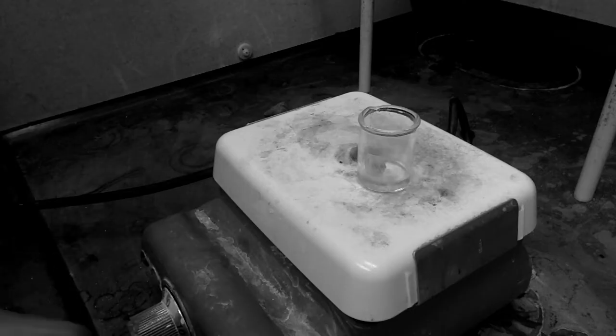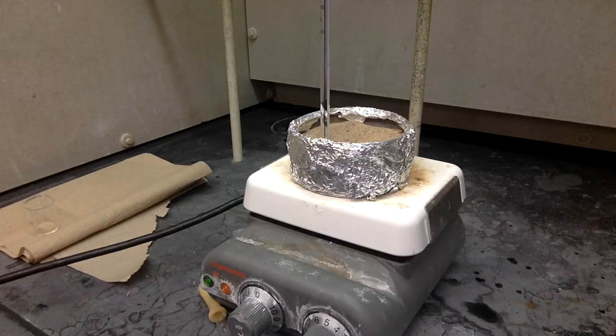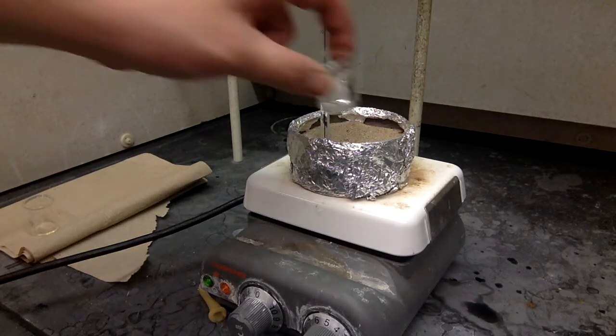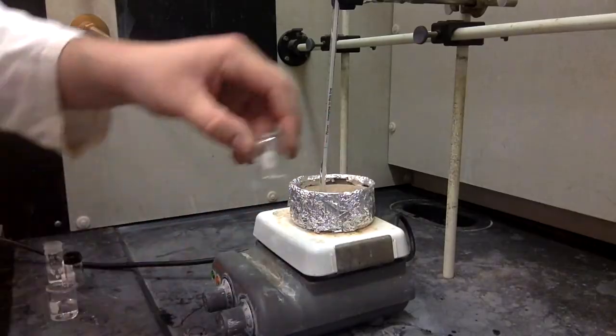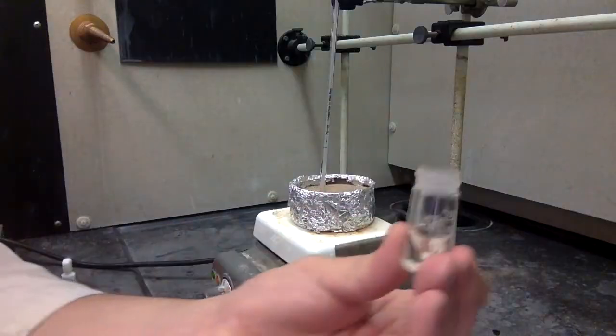Now here's the easiest part to screw up. You think everything's evaporating fine until suddenly you see a wisp. That wisp is your compound. Our product is a liquid and it has a low boiling point. So definitely do this in the sand bath and keep your temperature underneath that boiling point of your compound. Eventually you'll finish boiling and you'll end up with a thick yellowish liquid.